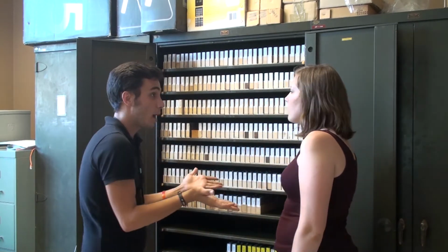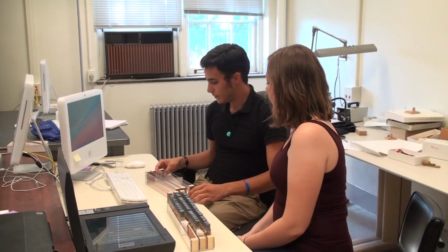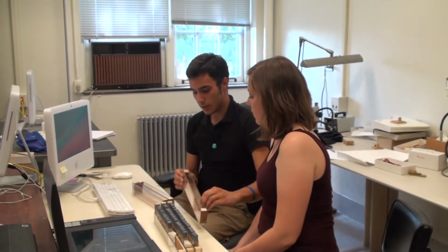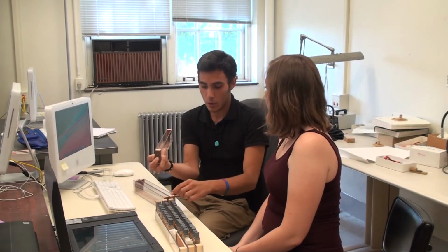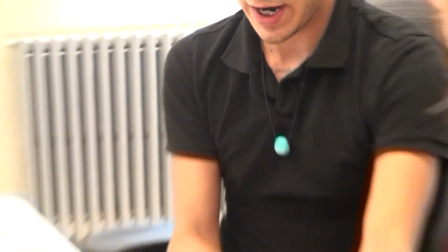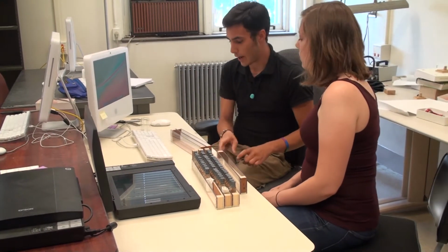Now, I think we're about ready to start digitizing, okay? So let's go. All right, Christina, we're going to begin imaging our vials. So here we've got custom imaging trays that we built to fit our flatbed scanner. Each of these trays has been labeled with a number 1 that will correspond with the starting point, our first tray, and also with a B and an F that will allow us to know where we started in the tray. And so we will put the front vials here on the F side of the tray, okay?